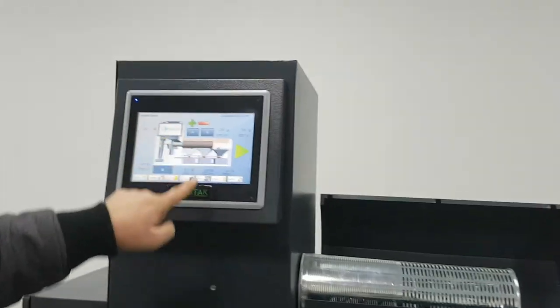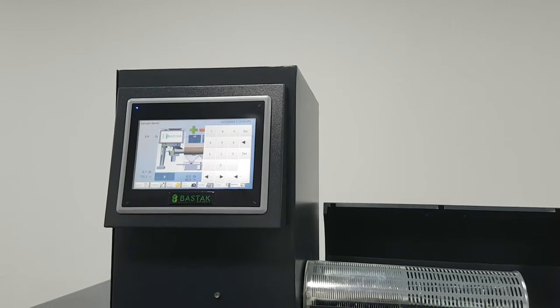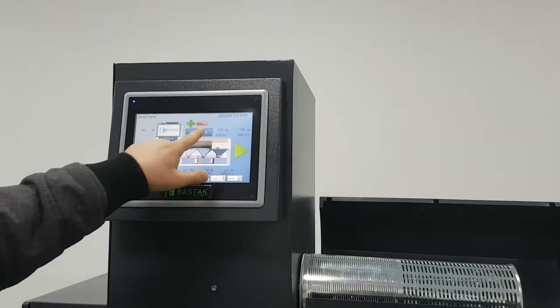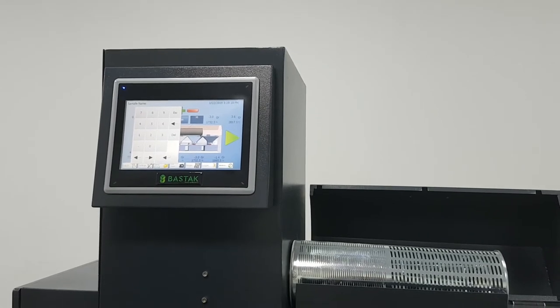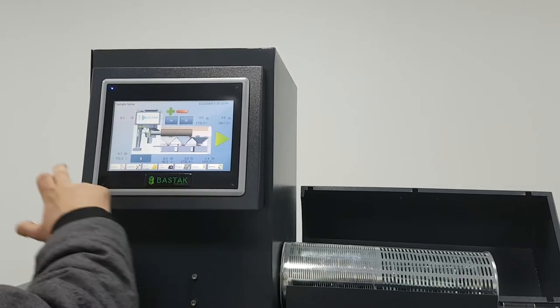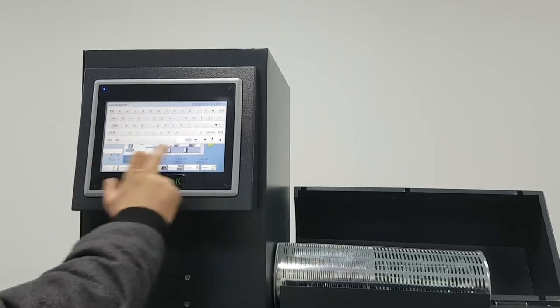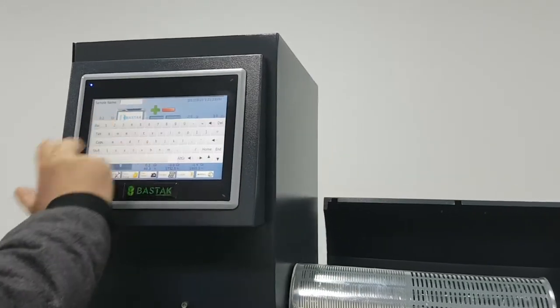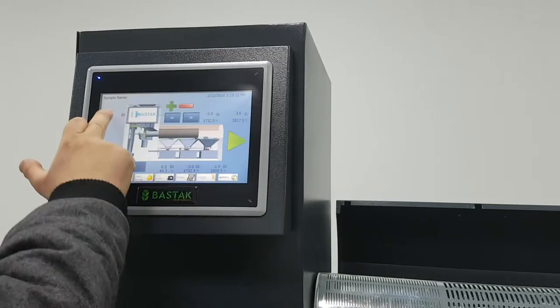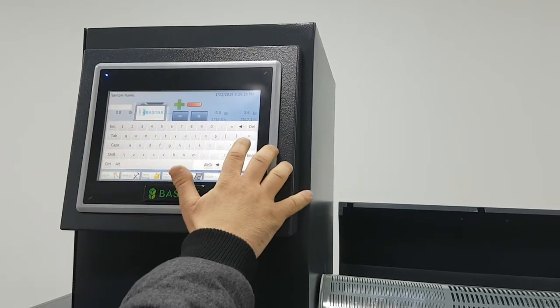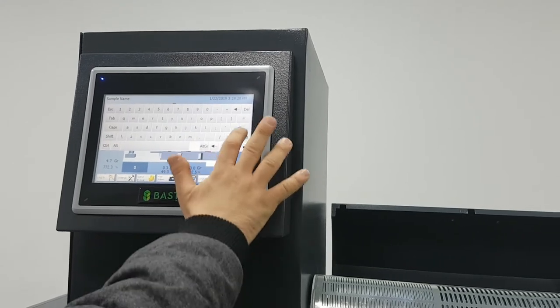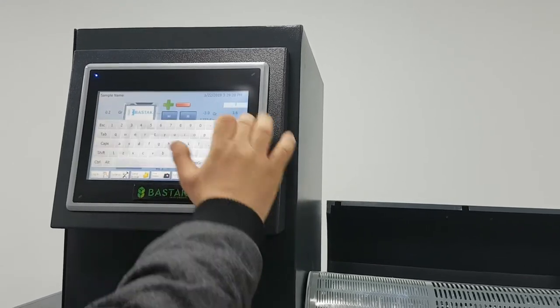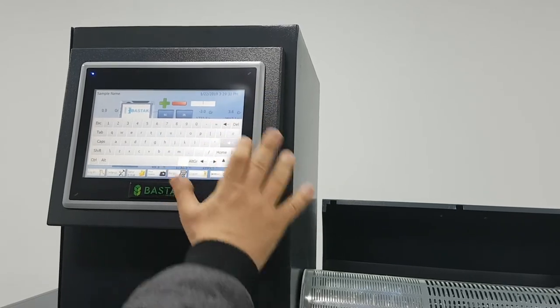Then we press back again. We can control the blowing strength from here - pressure. We can control the speed of the cylinder from here. We can give names for each drawer. We can give a name for the sample, for the total, everything. It's an interactive screen. Everything can be changed. Here also, this is for the materials, etc.